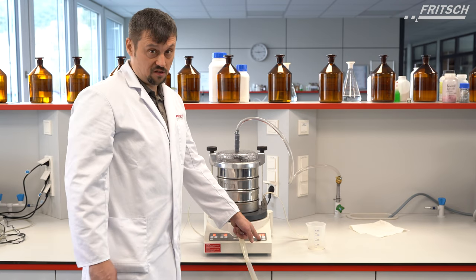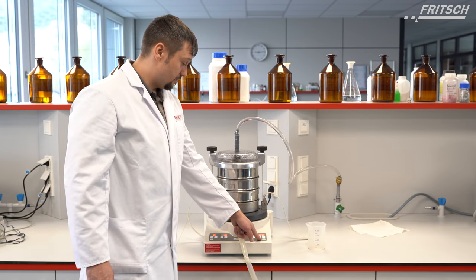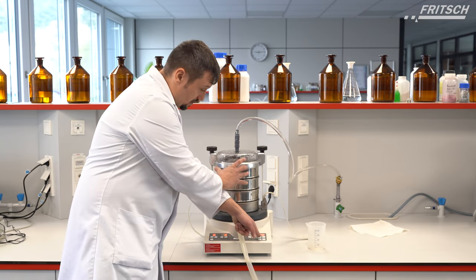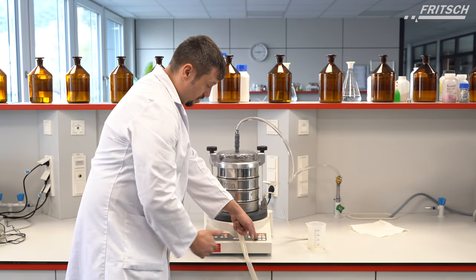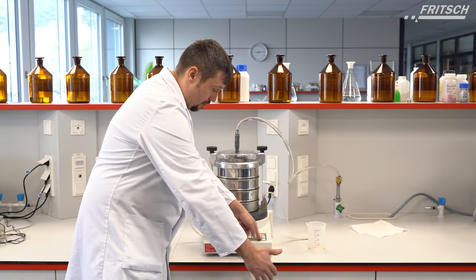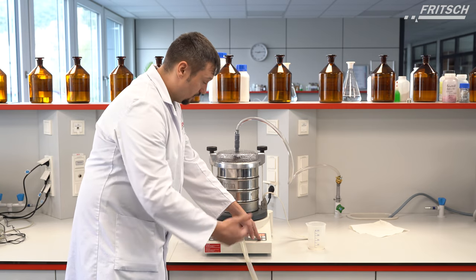Now we can start the sieving process. We have to check if all seals are tight and check the outcoming suspension to see if it is still clear.